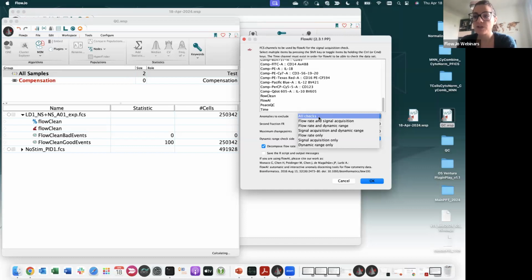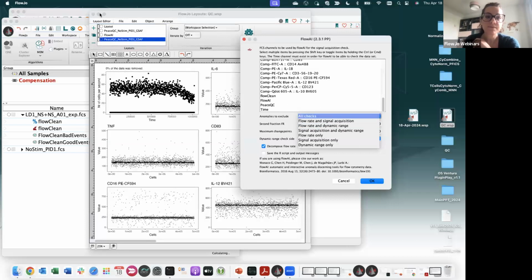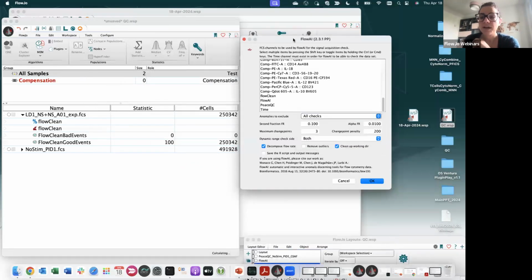So the more you change the flow rate in this case, the more events will be removed. So just keep that in mind when you run these algorithms, because if you did that on purpose, you probably want to either not check the flow rate, or not exclude the anomalies coming from the flow rate because you did that manually, or instead of using FlowAI, for example, you could use FlowClean, okay?